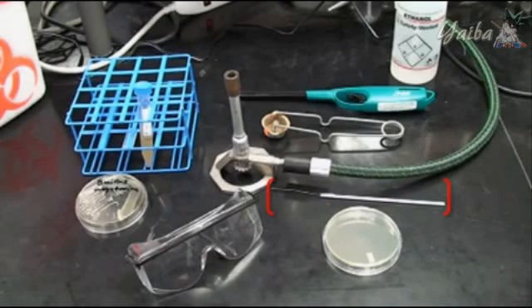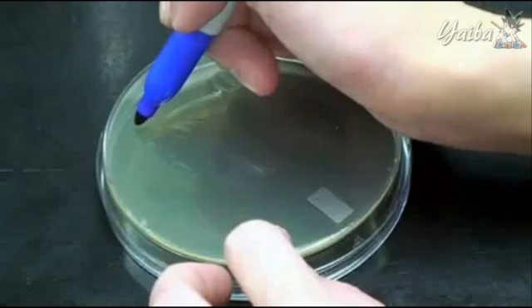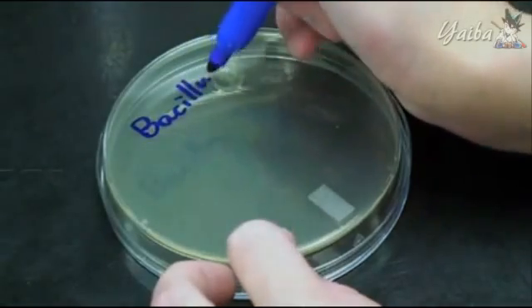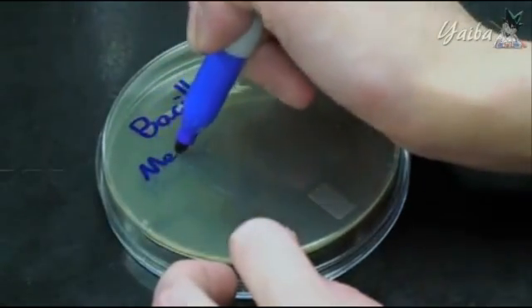an inoculating loop, which will transfer bacteria from either liquid culture or your solid culture onto your new plate, lighters, a Bunsen burner for sterilizing the loop, and of course, safety glasses. Before you do anything else, it's important to label your new plate, writing down all words and symbols identifying the contents.